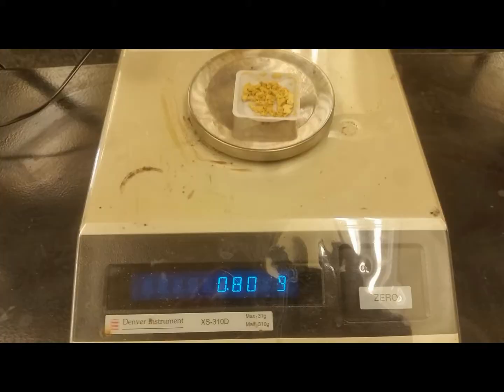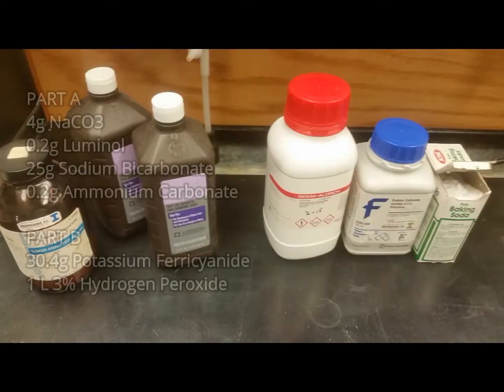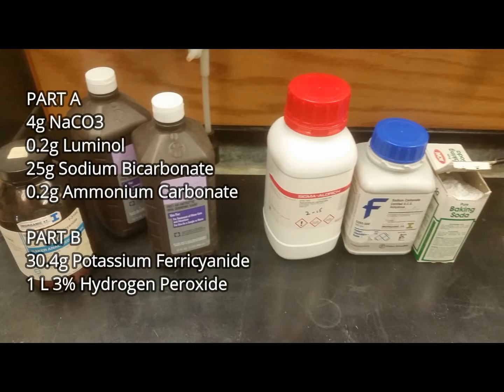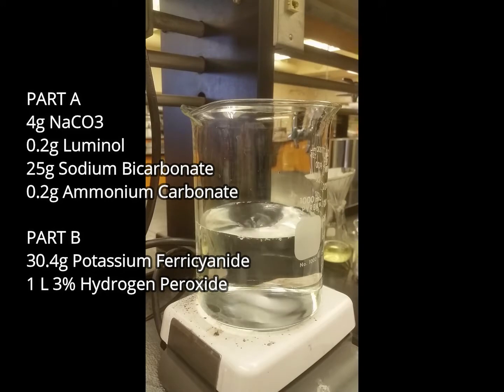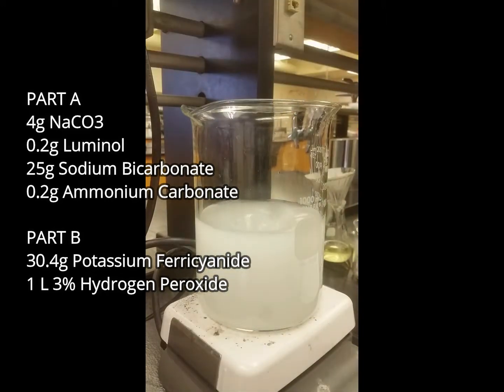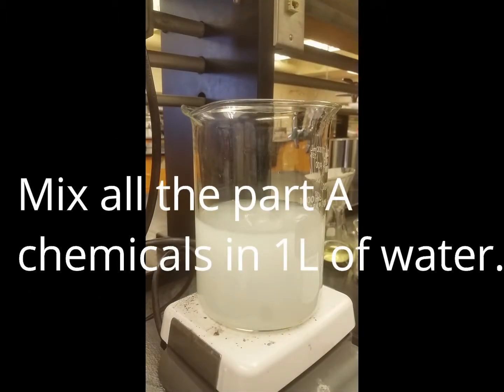Now that we have synthesized some luminol, we can use it to make 2 different solutions to create a luminol recipe. This is one of only many luminol recipes that can be found online. I chose this one because it said it produced the longest lasting glow.